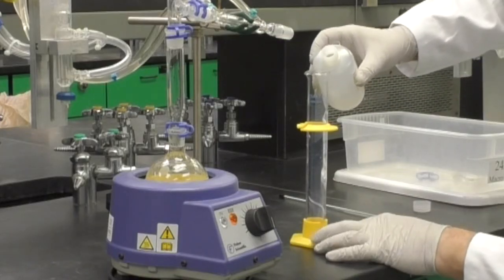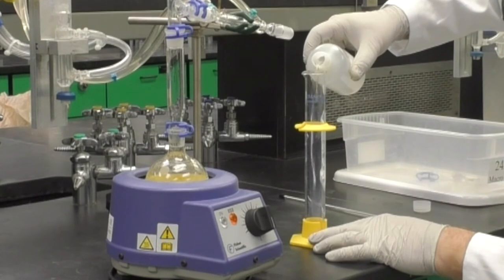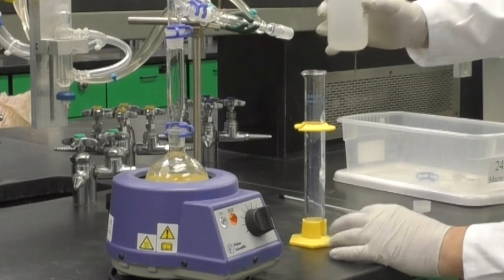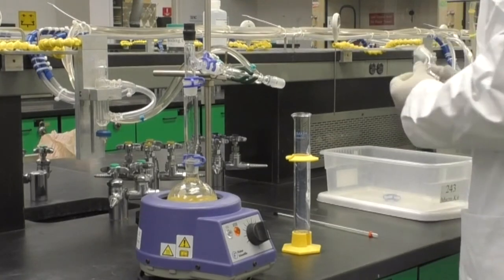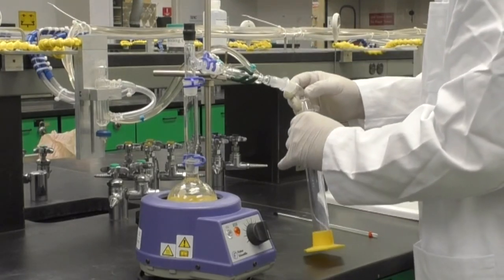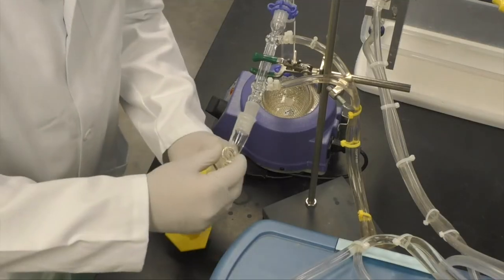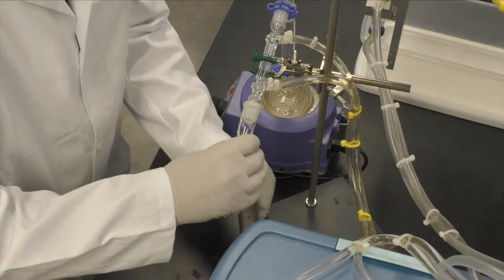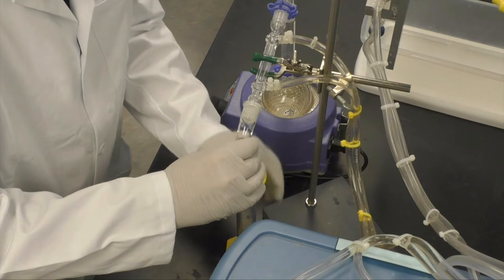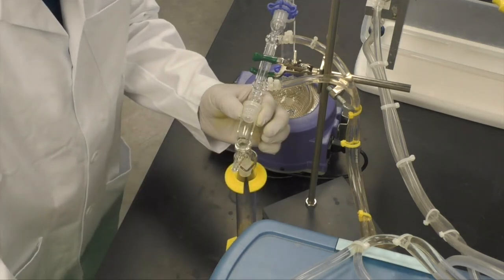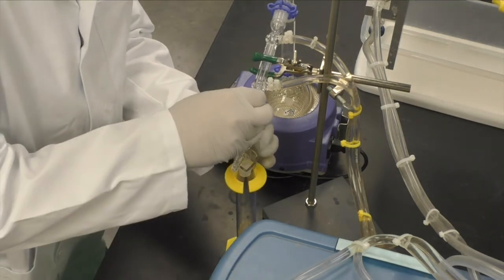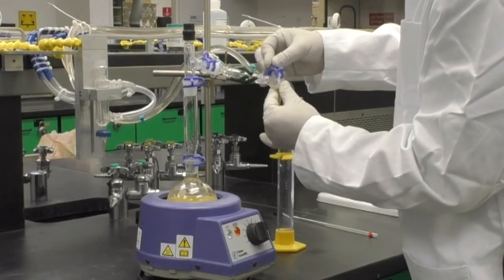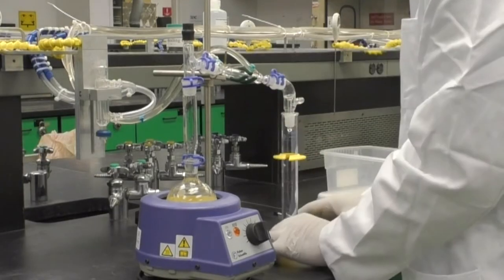Now add 10 milliliters of saturated sodium chloride to your 100 milliliter graduated cylinder. While holding the vacuum adapter and graduated cylinder together as one, angle the top of the graduated cylinder away from you and slip the adapter onto the end of the condenser. Then rotate the adapter as you stand the graduated cylinder upright. Attach the adapter to the condenser with another Keck clip.